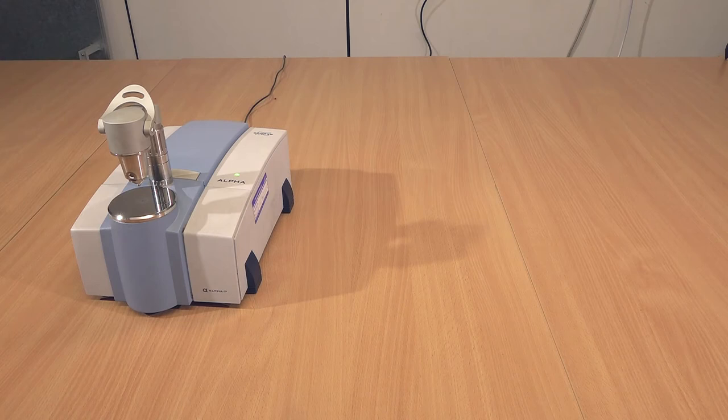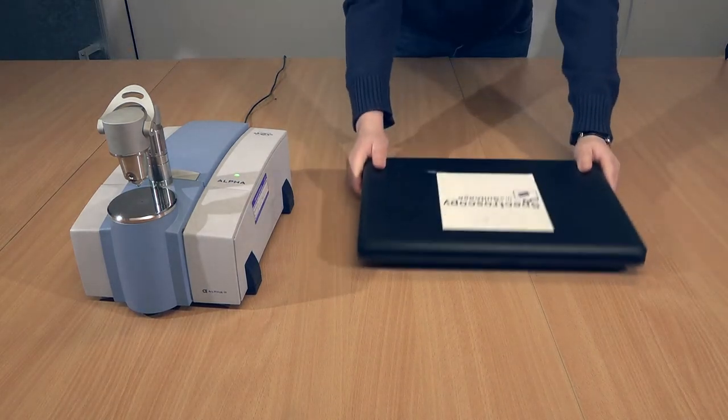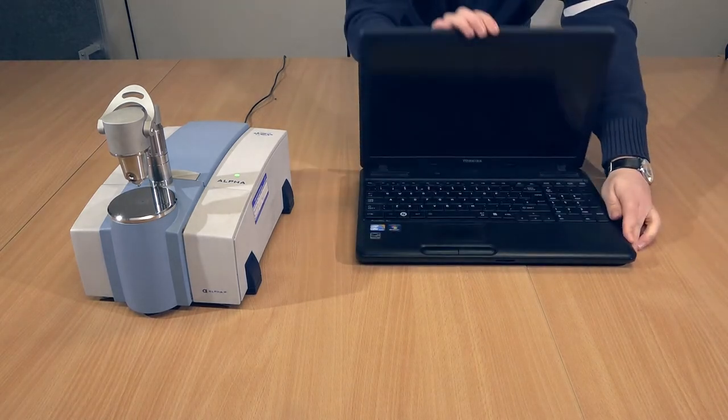This gives it time to warm up and run any necessary diagnostic tests. If possible, plug in the IR earlier, even if you don't connect it to the computer until 30 minutes before. This gives time for the internal dehumidifier to work. Set up the laptop to the right of the IR spectrometer and plug it in.